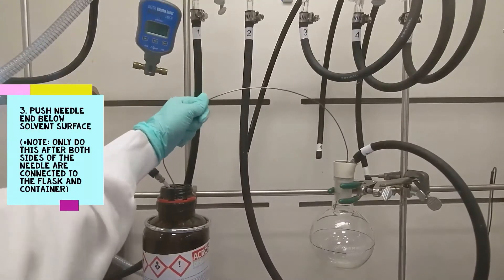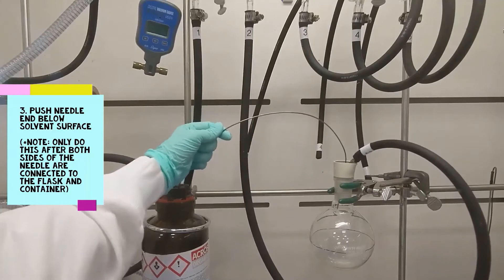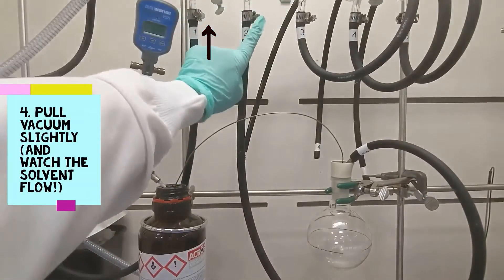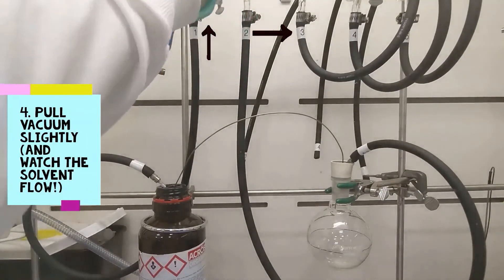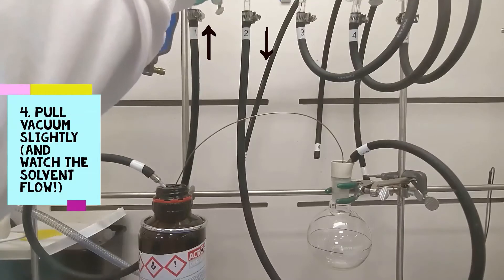Pour the water into my flask, draw the line around the round bottom at the meniscus with my Sharpie, and then I let the flask dry in the oven overnight. In your cleanup, a quick acetone wipe will easily take your markings off.